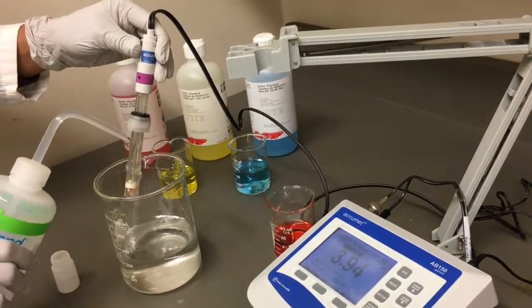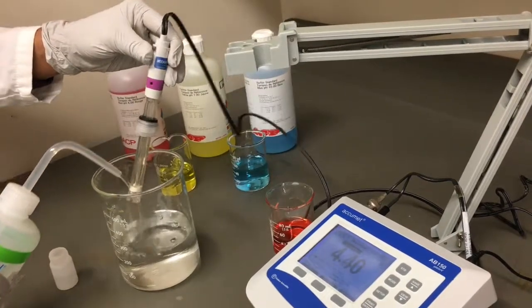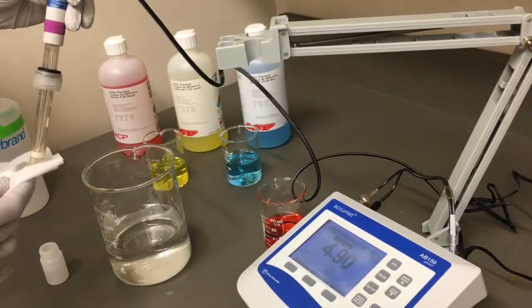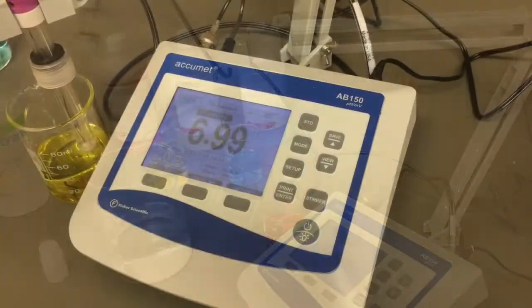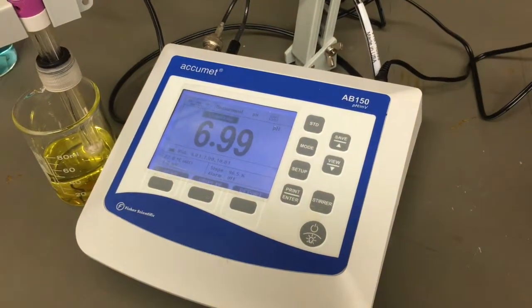Rinse the probe well between solutions with clean water, again removing excess water carefully with a kim wipe. Place the probe into the next standard solution.